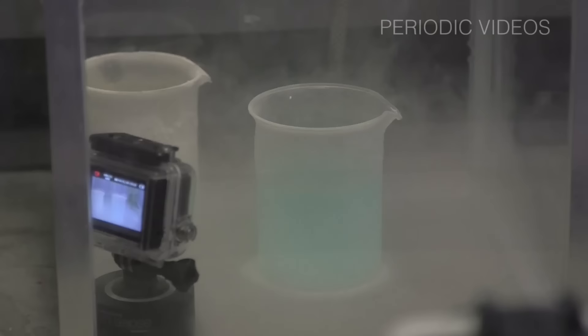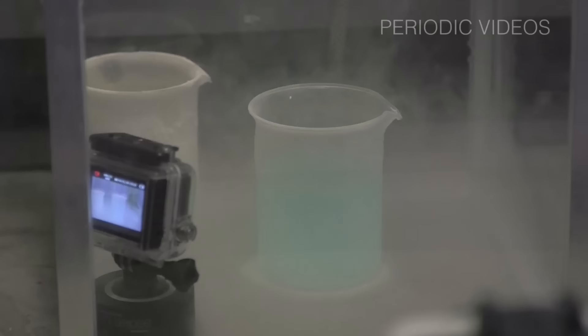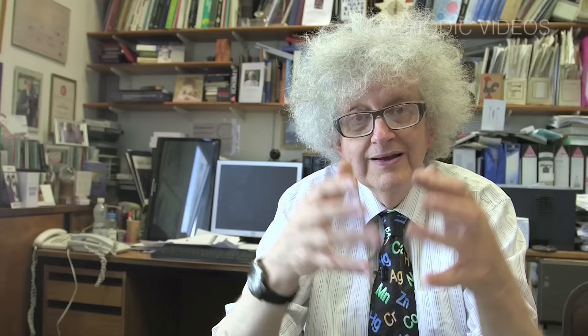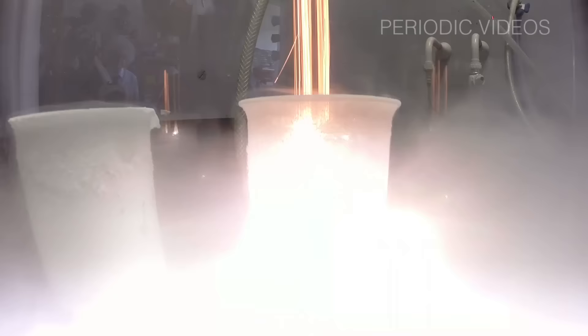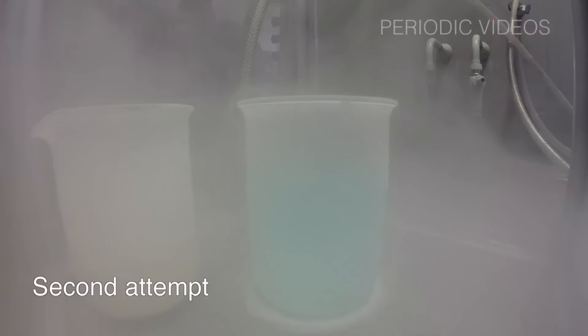The experiment was moderately successful. What I was hoping to see was the iron going in, sitting on the bottom, and burning surrounded by bubbling gas. Of course, what happened is that when it went in, there was such a bright flash that it was pretty difficult to film, though Brady used some quite good tricks to get round this. And we couldn't get rid of all the ice forming.